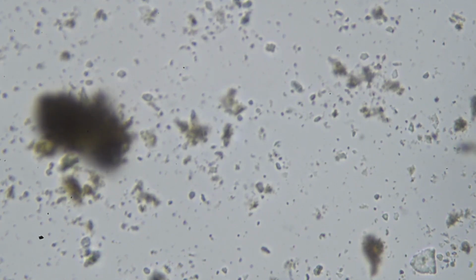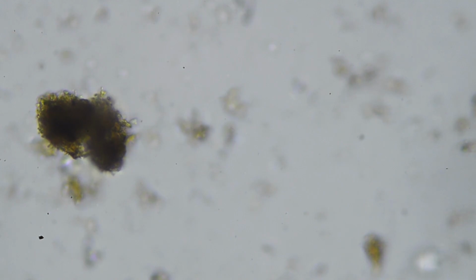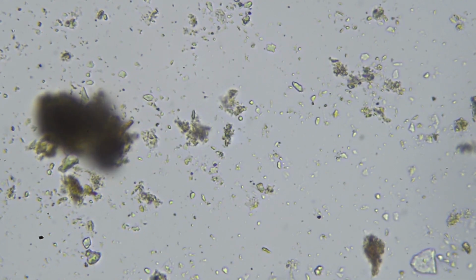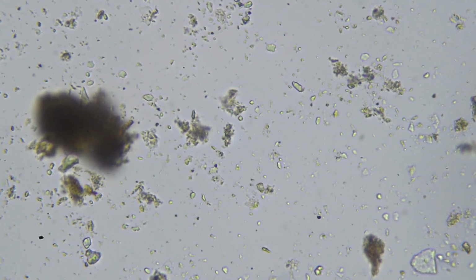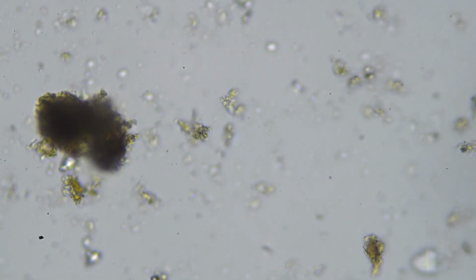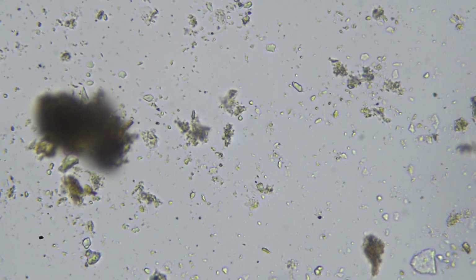So I think direct microscopy, if you feel suitably inspired, definitely investing in a relatively cheap £200 to £300 microscope is really quite fascinating. So yeah, just having a wee zoom in and out of this sample here and looking for different shapes.